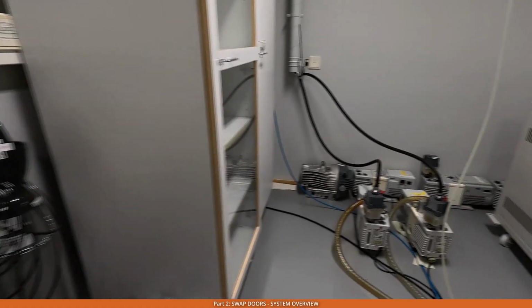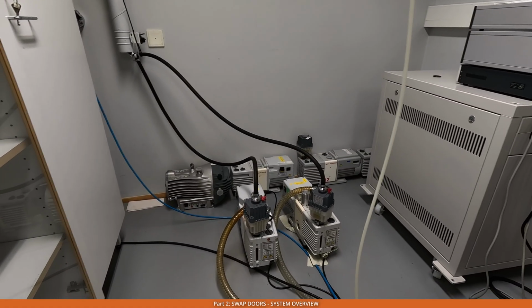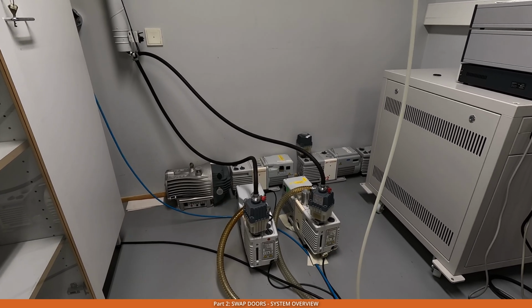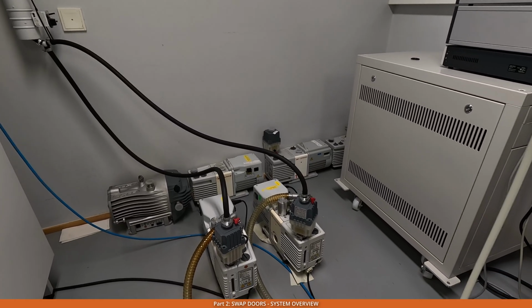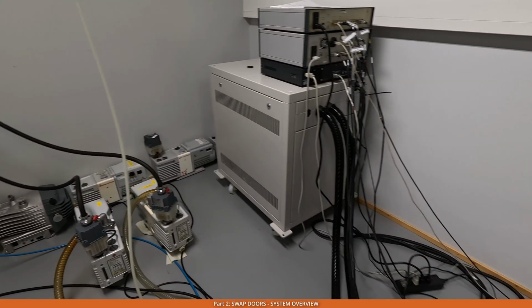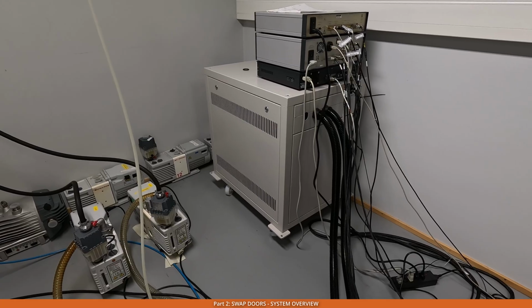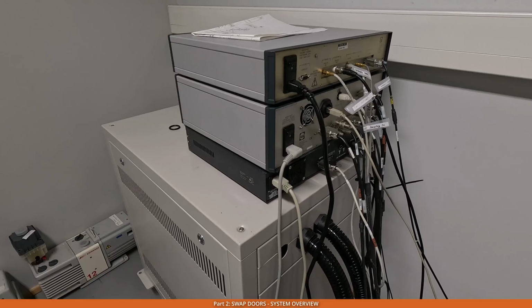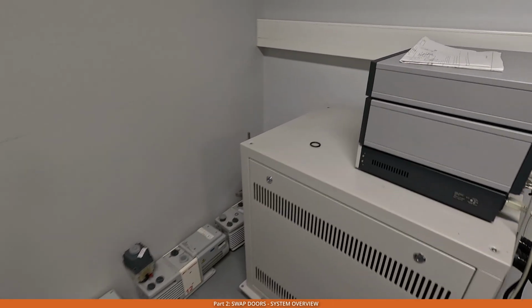Behind the microscope we can see two pumps. On the left hand side there is the rotary pump, pre-pump number 1 for high vacuum, and on the right hand side there is the second pump for low vacuum mode. Then on the right hand side from them you can see the box with the power supply for the microscope, and then 3 boxes for the Gatan 3-view system. Let's go around them.